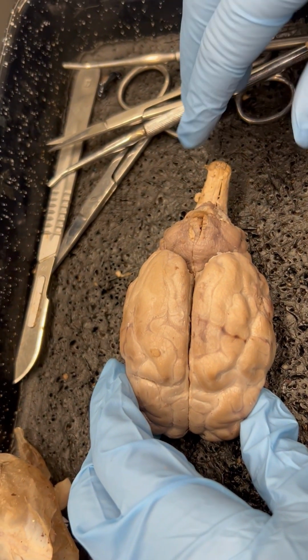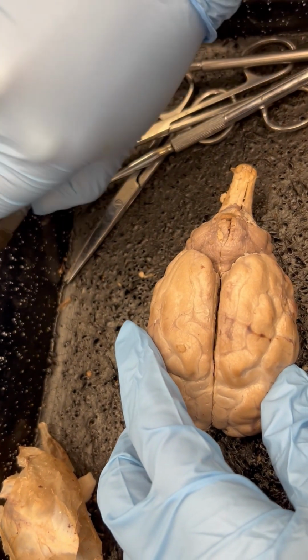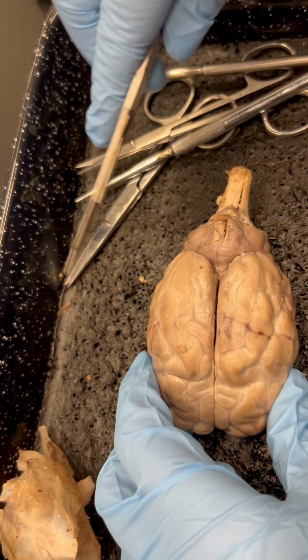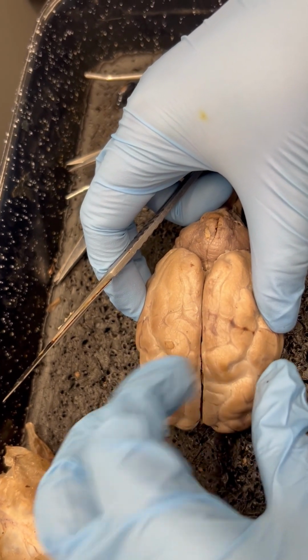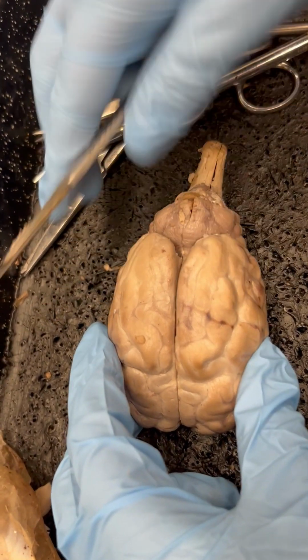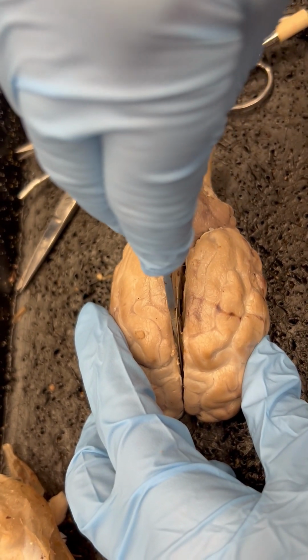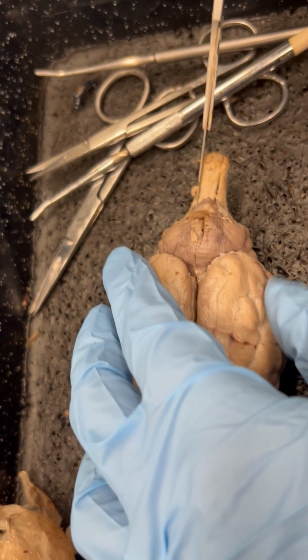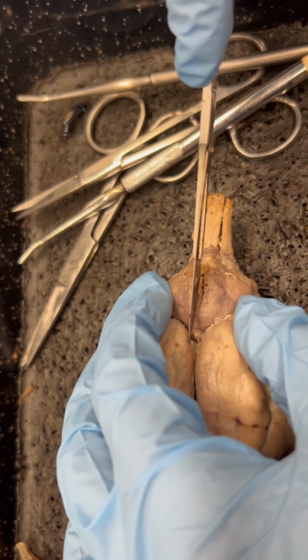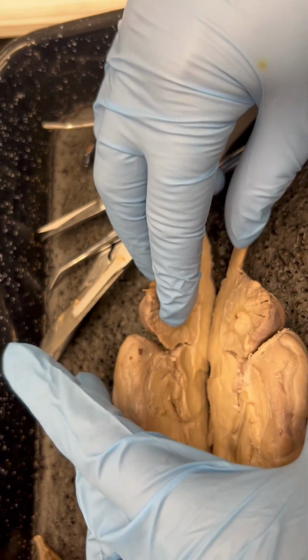To start for this, we are going to have to make a sagittal cut. So I have already made a cut, but I'm going to show you how to make yours. So you're going to use your scalpel, and you can use this median sulcus as a guide to stay along midline. You're going to want to cut all the way down with your scalpel. That way you're not doing a hacking back and forth motion. And you just want to follow it along. And once you get to your cerebellum, just stick to as much along midline as you can and cut all the way through. So here we go.